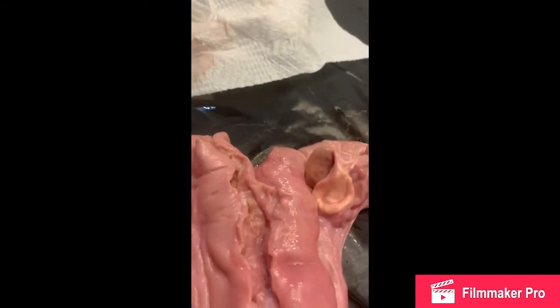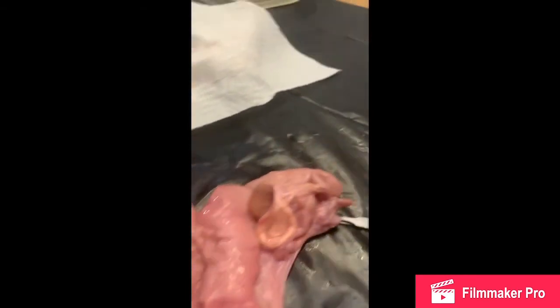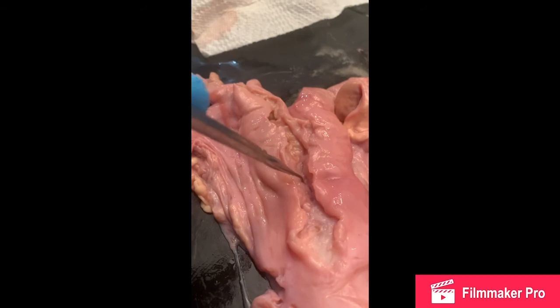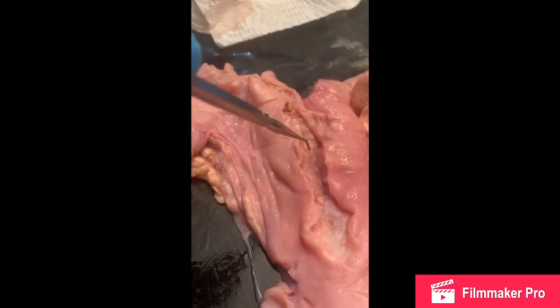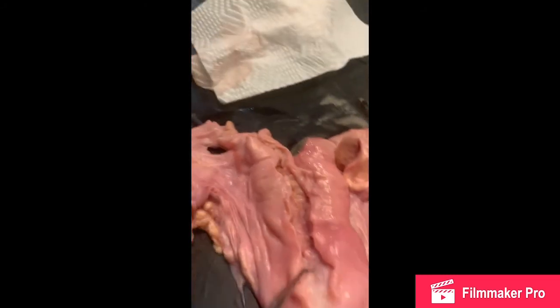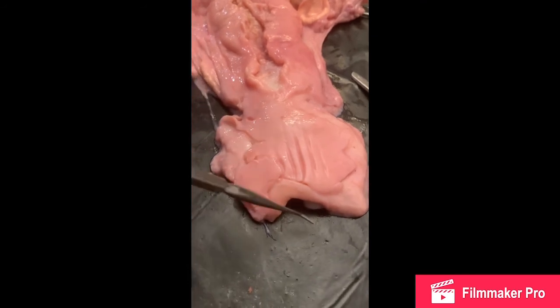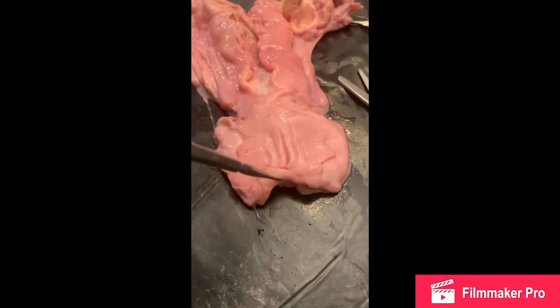Okay, so as we had looked back here prior, we're going to see that we had made an incision down here. We can see our cervix. I did cut down the center, so we have this here and this here that's going to lead down to our vagina, which is right here. As we can see, there is the small opening down here.